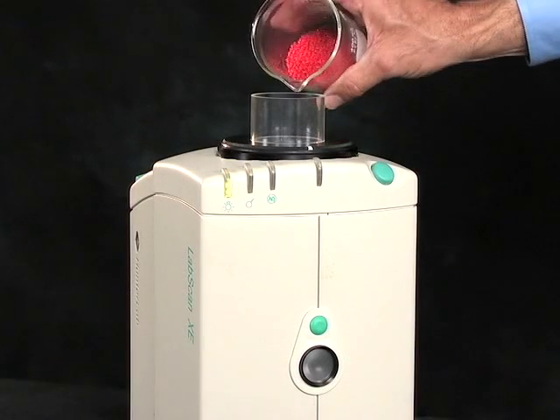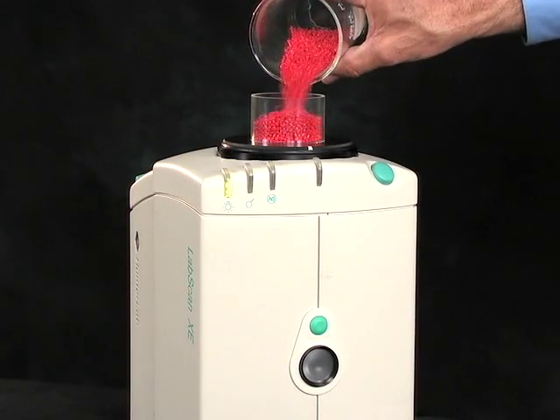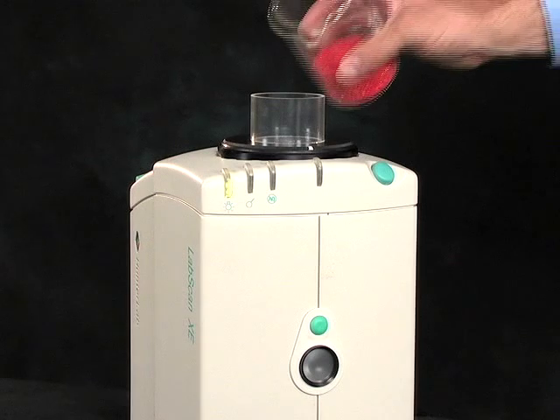Then dump, refill, and read the pellets again. It is best to repeat this process at least five times.